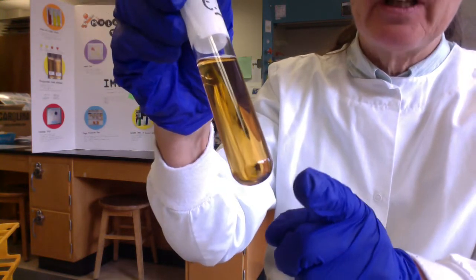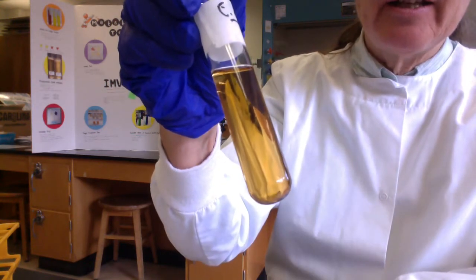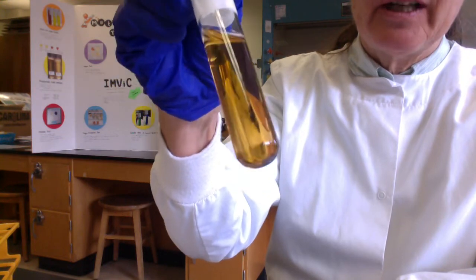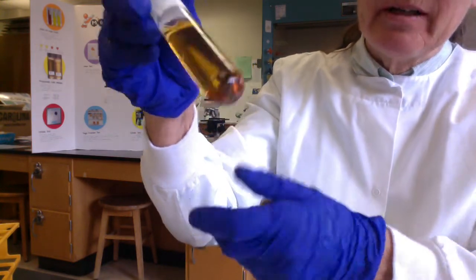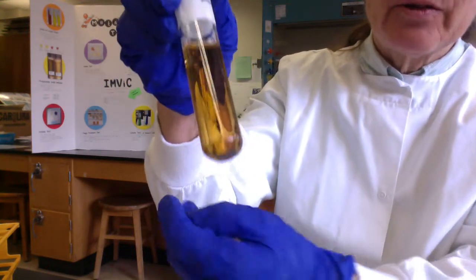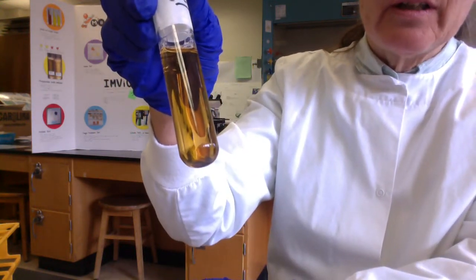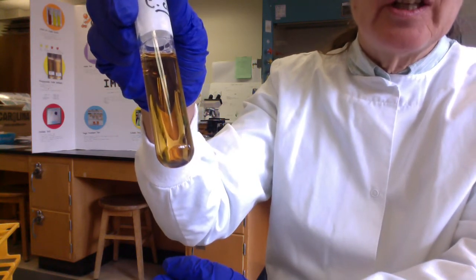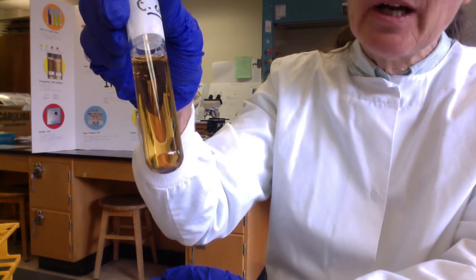Now, however, folks, if I had inoculated this with E. coli and I incubated it and I pull it out of the incubator and it's transparent, I'm going to check the bottom to see if there's a pellet. I'm going to shake it to verify that it's not cloudy or turbid. Okay, so recall that cloudiness or turbidity is a sign that cells are present, and usually we use it as an indication that our culture grew.